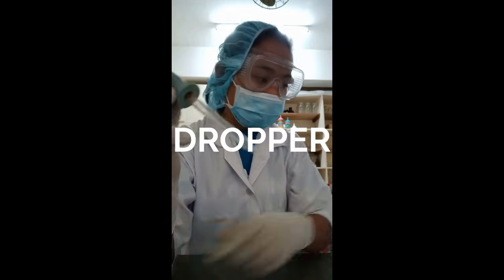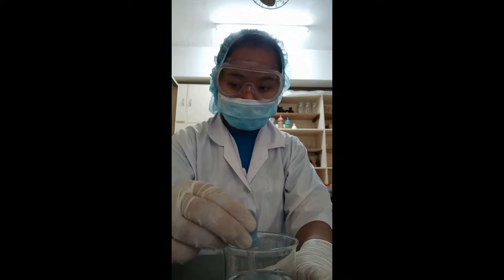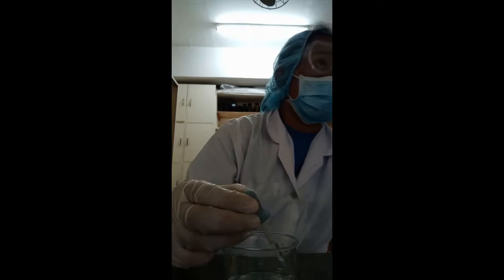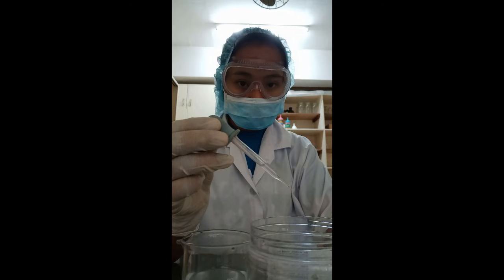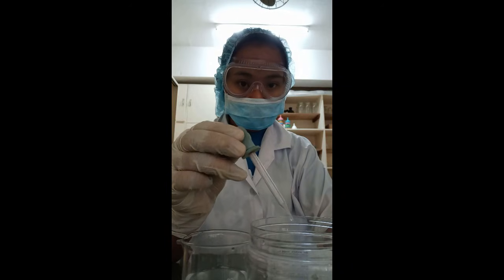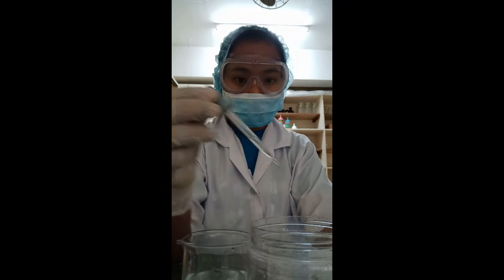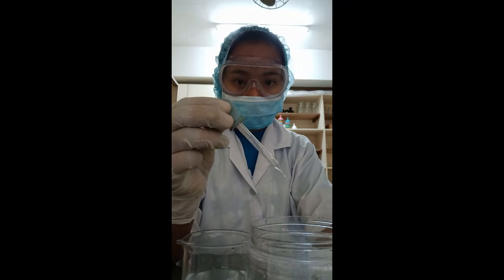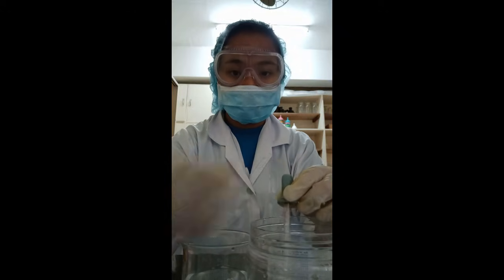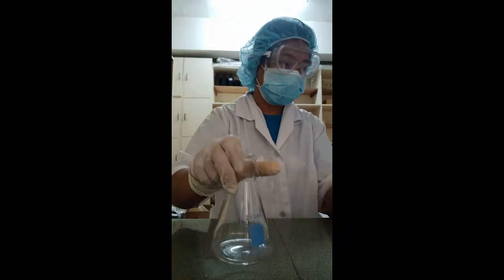Droppers. Small glass tubes with narrow tips on one end and a rubber bulb on the other. It sucks up liquid that can be squeezed out in small drops. Erlenmeyer flask. It is also called the conical flask.